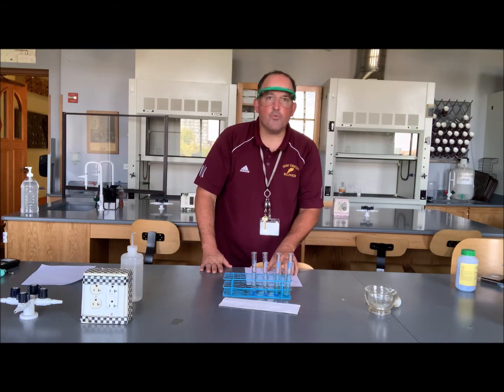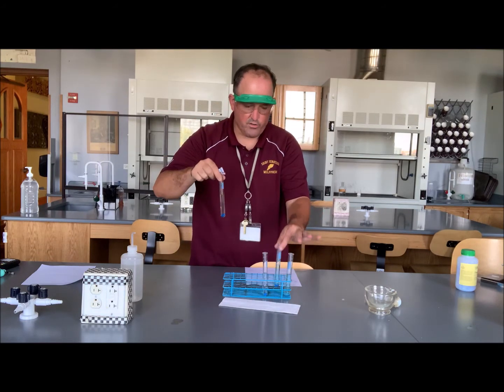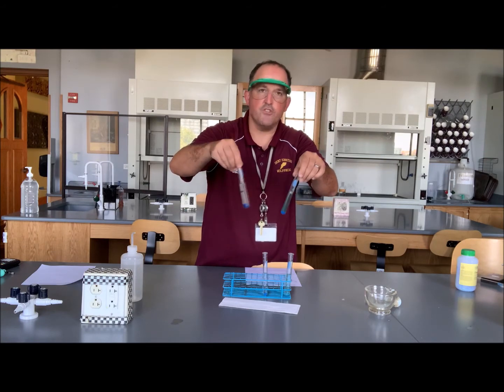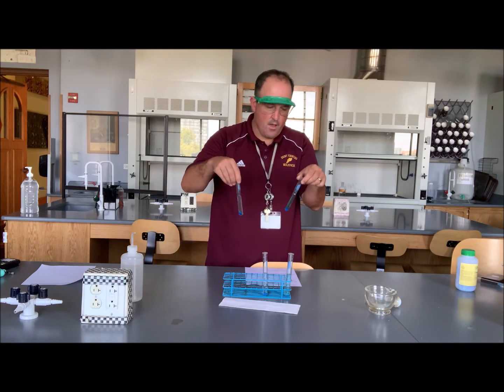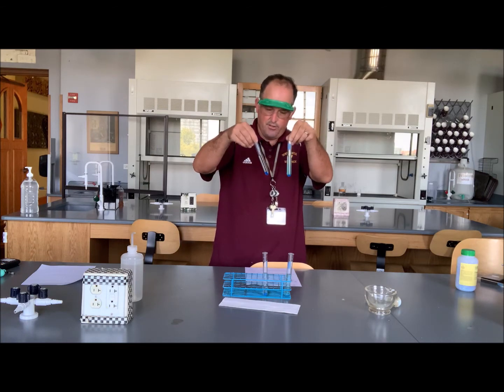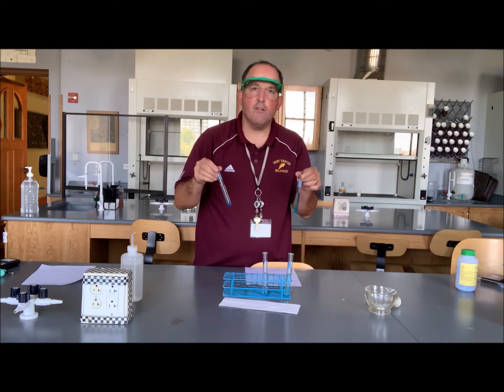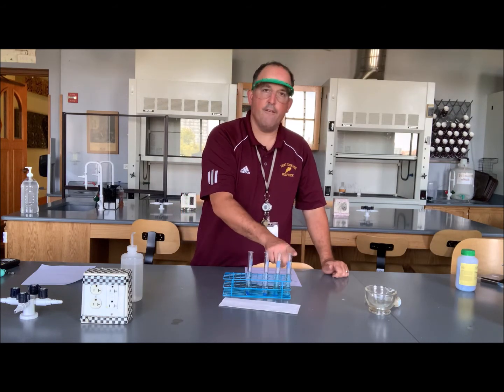I'm going to begin swirling now. I'm going to swirl test tube 1, which has a full-size crystal, and I'm going to swirl test tube 3 with a crushed up particle. Now swirling a test tube just means making little swirly motions with it, or any kind of an agitation. If you had a machine to do this, that'd be nice. But what we're going to do is time how long it takes the copper sulfate in each of these test tubes to dissolve. Now it might be a while, so I'm going to pause the video and then we'll come back and make observations. So the test tubes go 1, 2, 3, and 4.